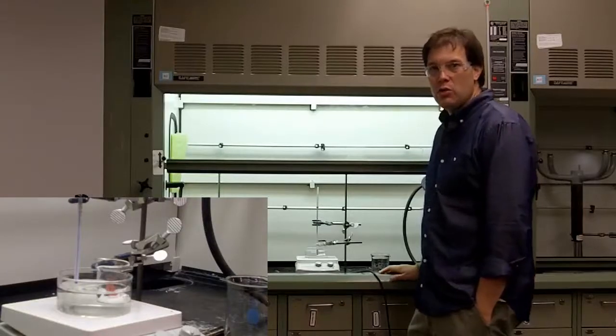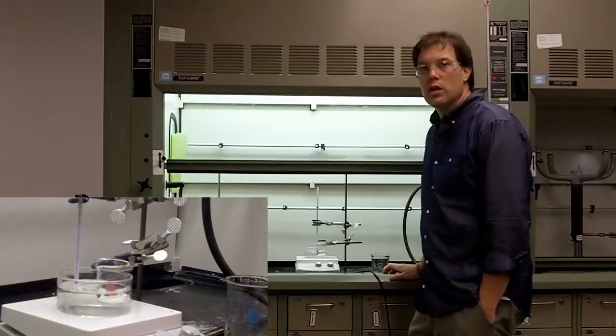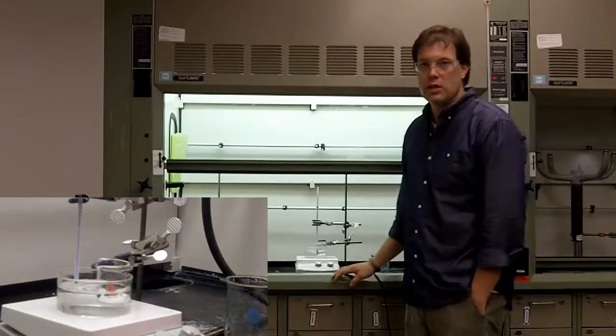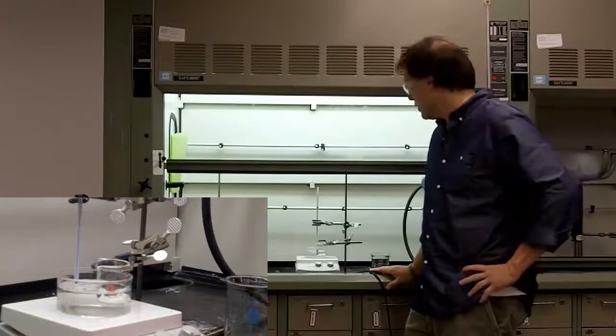This is a very quick video showing you a convenient setup for recrystallization. I'm not going to go into the theory of recrystallization as that will be done elsewhere, just the basic setup for it.